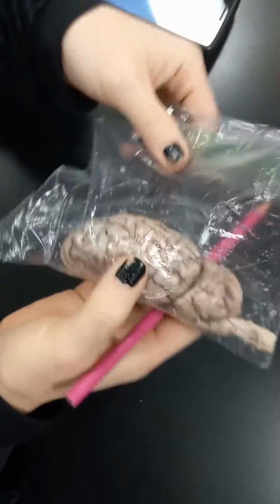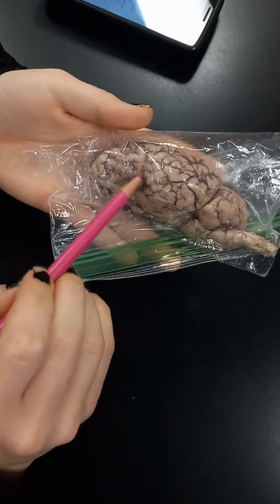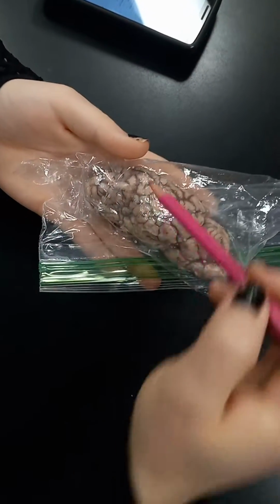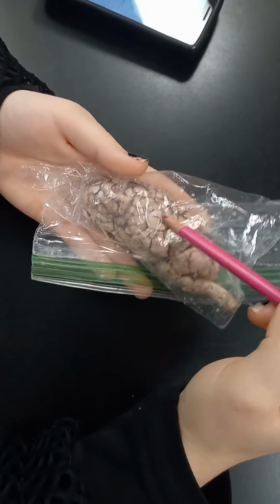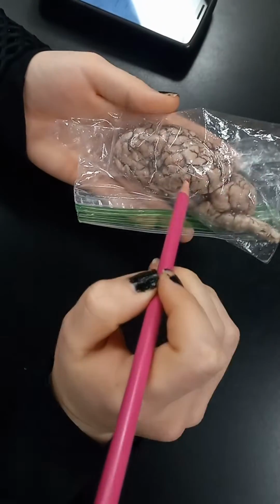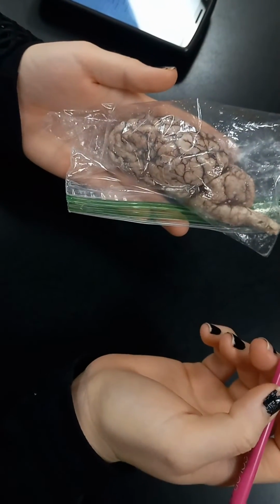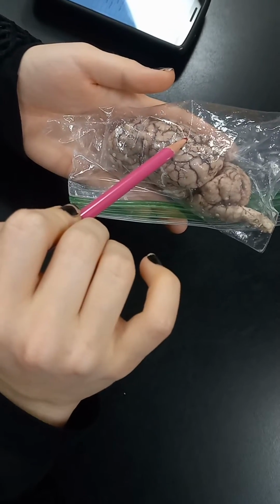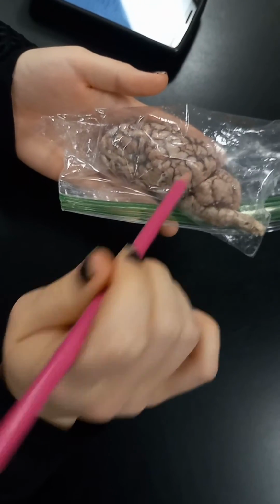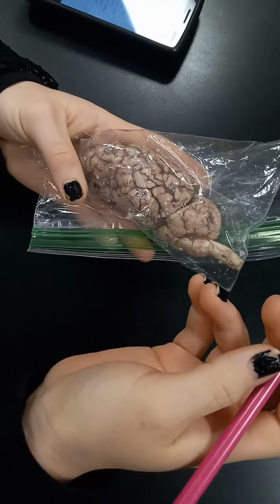And then for the areas of the brain, Broca's region would be kind of in the front. The motor area would be this strip here. The sensory area would be kind of behind it. And then Wernicke's area would be in the back. And so the way I remember that is alphabetical order: B for Broca, M for motor, S for sensory, and W for Wernicke. And the last thing that you will need to know is the gyrus versus the sulcus.